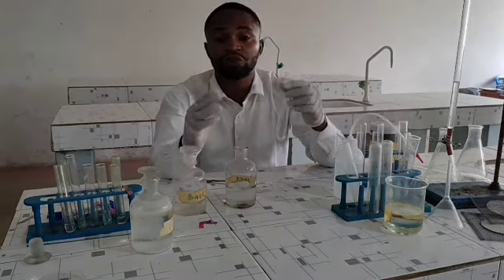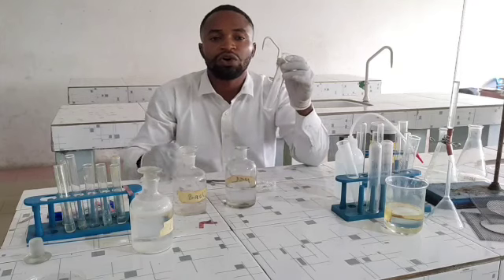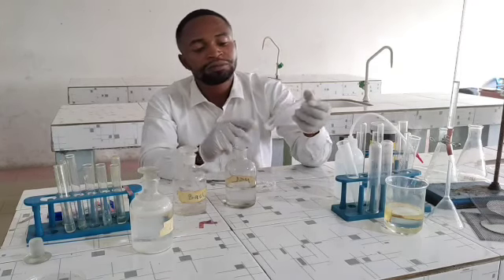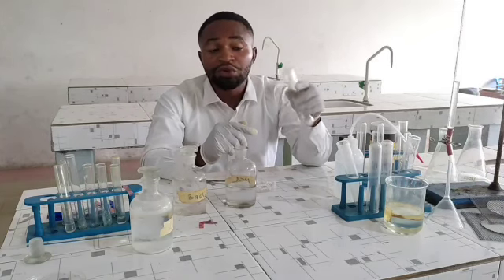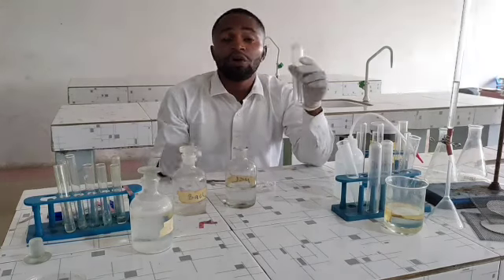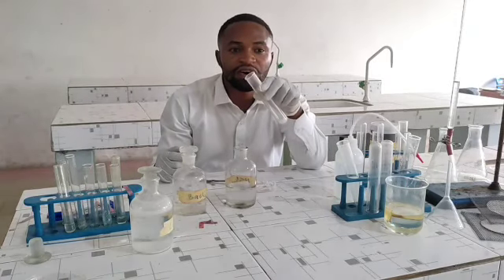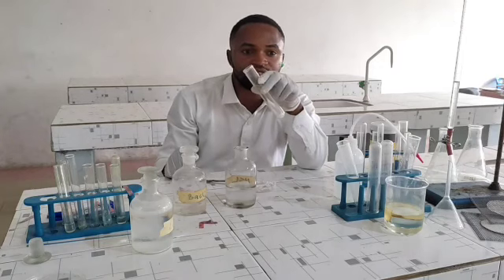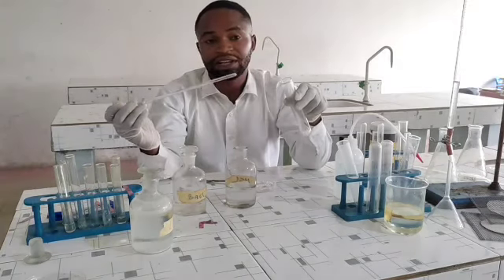Remember, I'm not teaching you this for you to cram. I'm teaching you for you to understand why these reactions are taking place and why they are using these steps to test for or to analyze this salt. Now, you'll be required to take sample C and heat gently. Even without heating, or if you heat this salt, a colorless gas with a choking smell is going to be liberated.